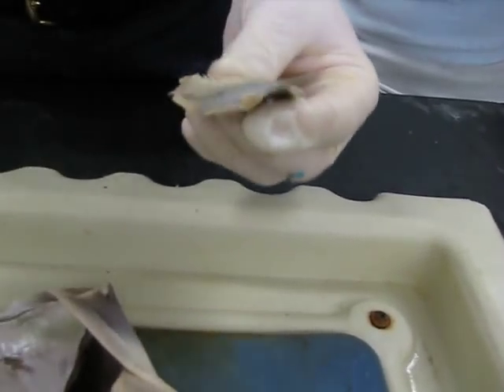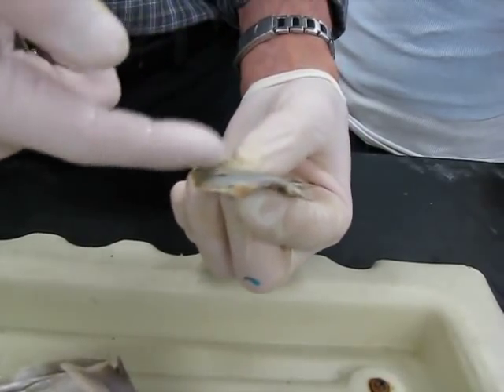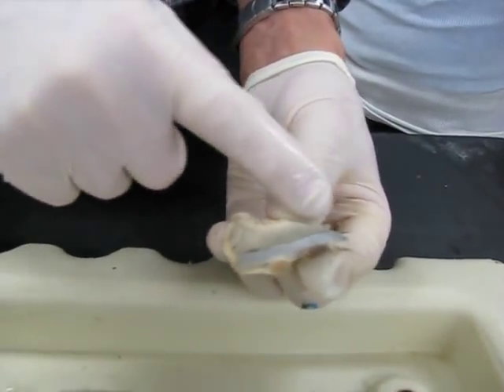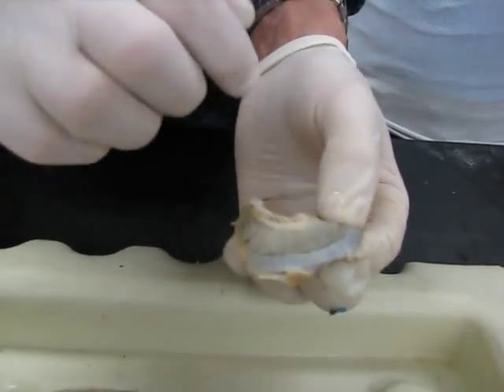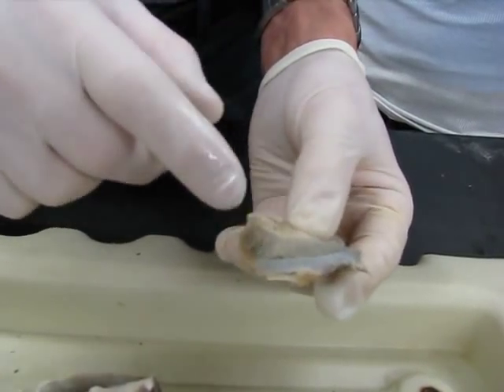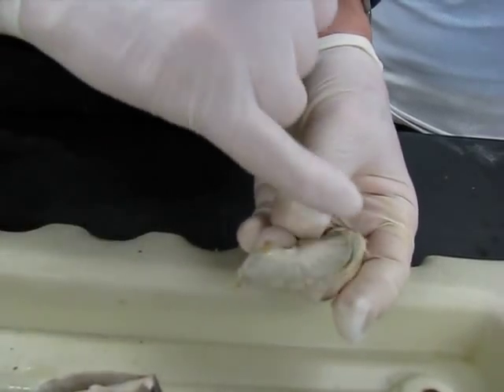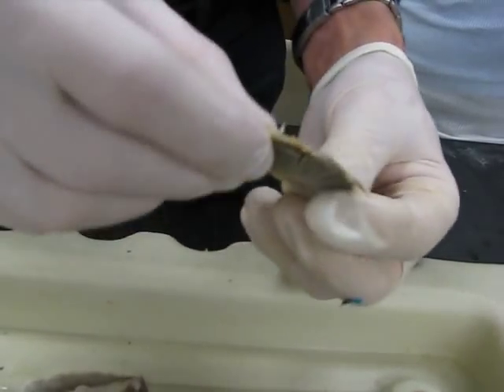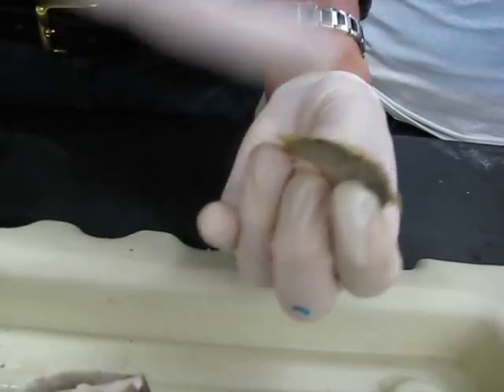And finally, gill rays — you can't see them on this because they project on the inside, behind those gills, off of the gill arch, sticking up and supporting the whole structure. This whole set here is called a demibranch. If you flip it over, there's another demibranch on the other side, so one demibranch and this demibranch together form a holobranch. So the one gill arch has a holobranch — both sides of the gill structures.